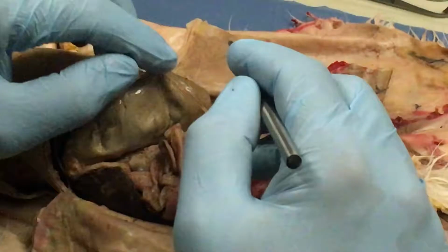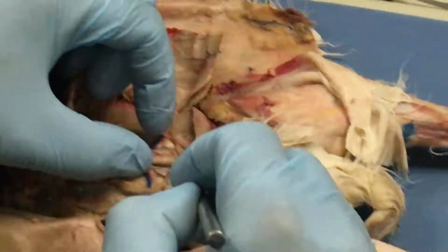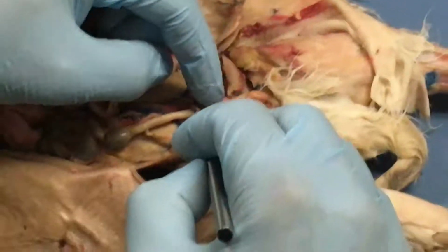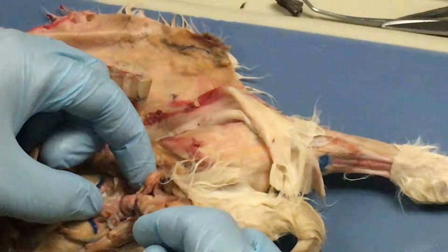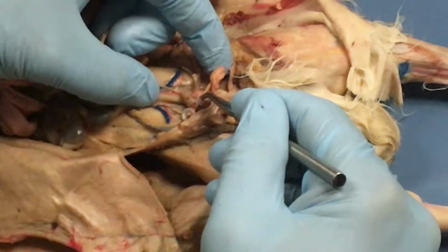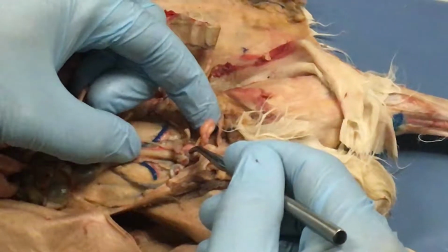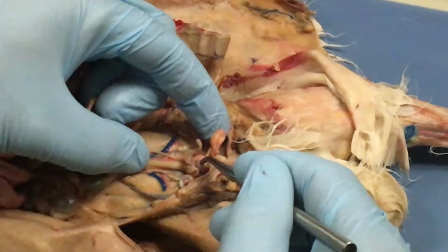All right. Let's see. Urinary bladder. This rabbit has a very, very small urinary bladder. That's it right there, just that little tiny thing. So make sure you go around looking at urinary bladders on these rabbits, because some of them are huge.